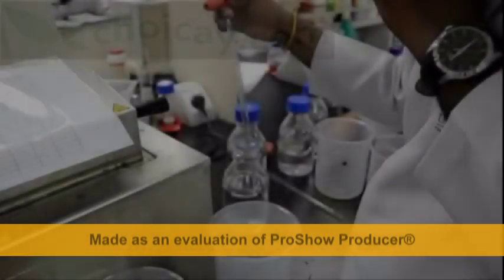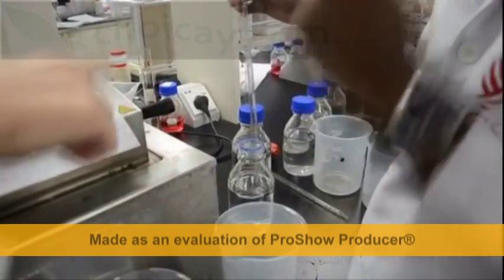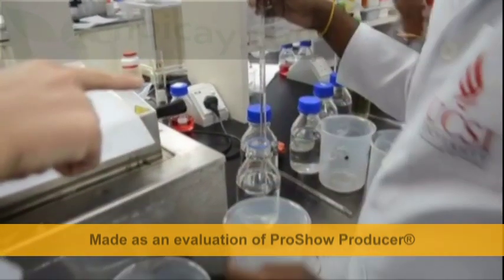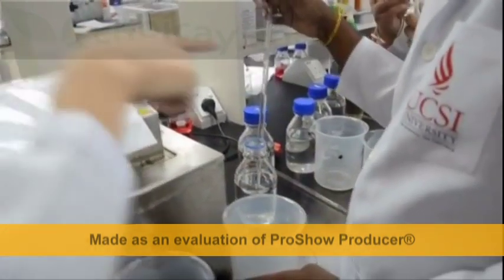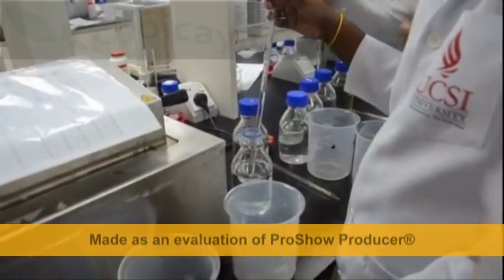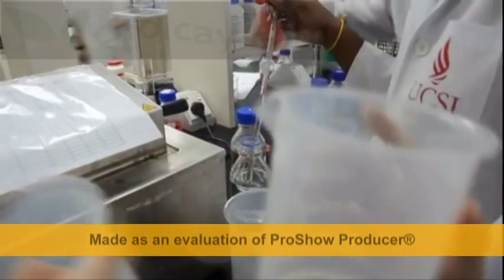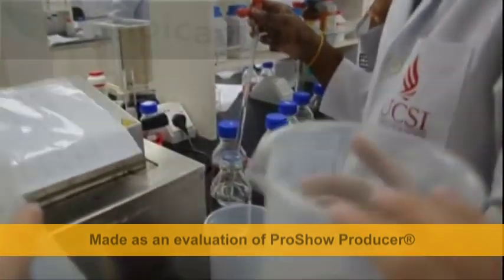In this video, we are going to show the step-by-step procedure of seed surface sterilization, germination, and the hardening process.